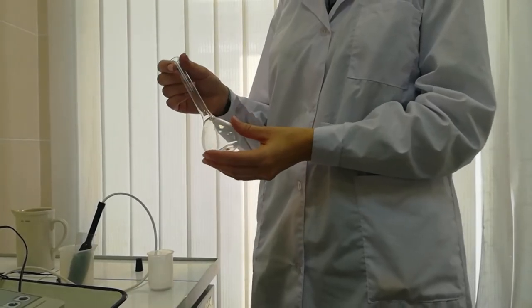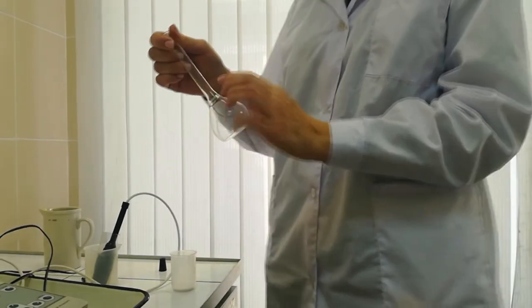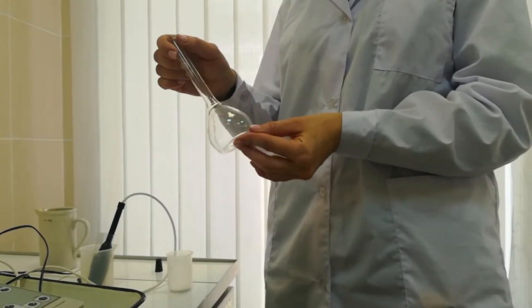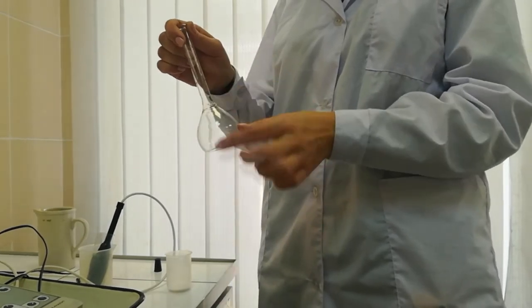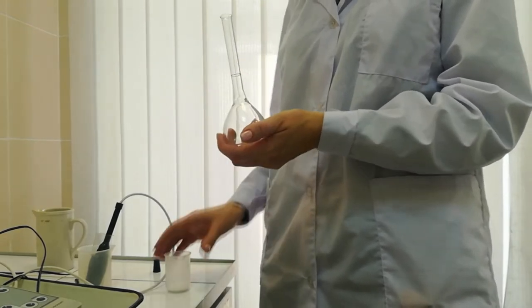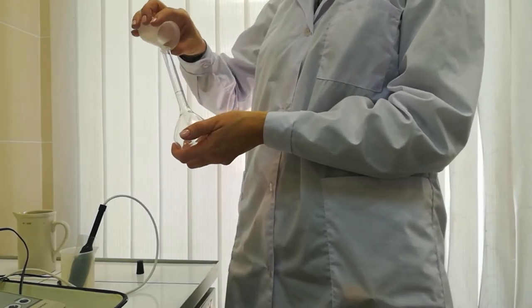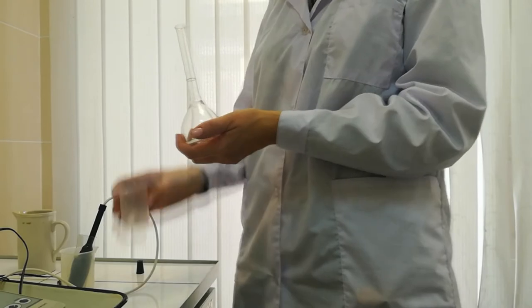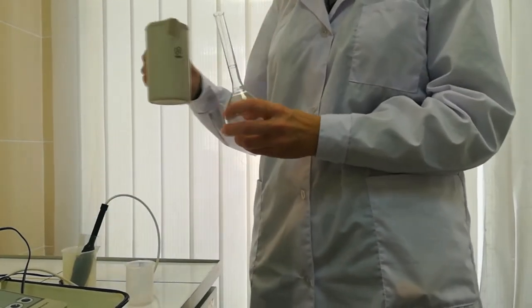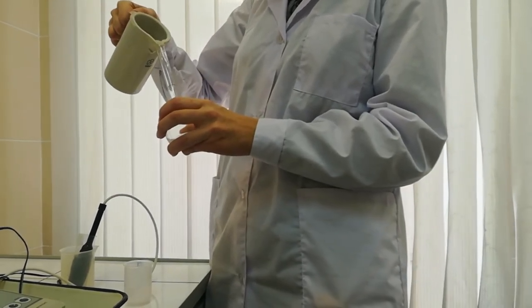Now we take a volumetric flask — there is a special mark on it. This flask is for 100 milliliters, so if we fill water up to that mark, the volume will be exactly 100 milliliters. We transfer the salt from the glass into the flask, then add some distilled water.